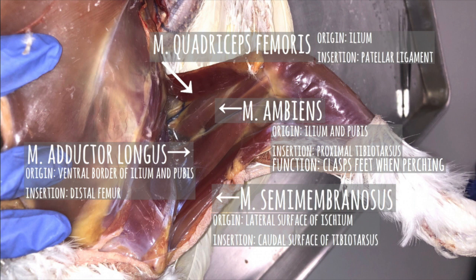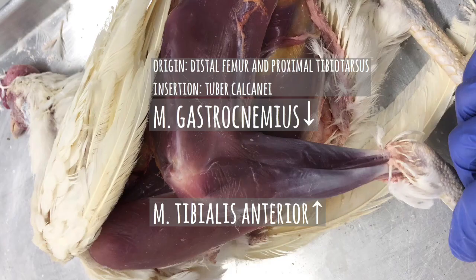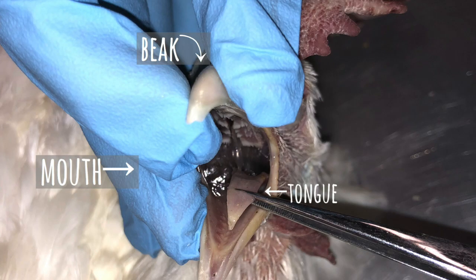M quadriceps femoris, which extends the thigh, the M ambiens, the M adductor longus, which adducts and extends the thighs, the M gastrocnemius, which flexes the knee and extends the foot, and the M tibialis anterior, which flexes the metatarsals forward. Now onto the digestive system.